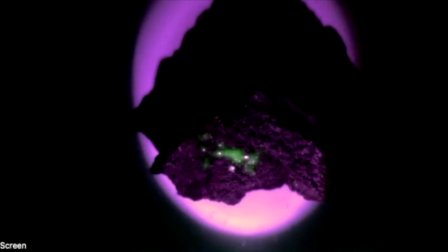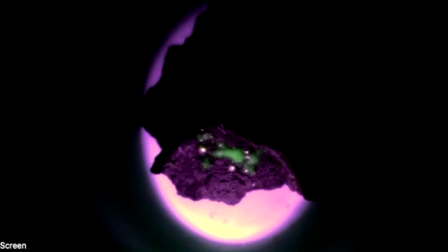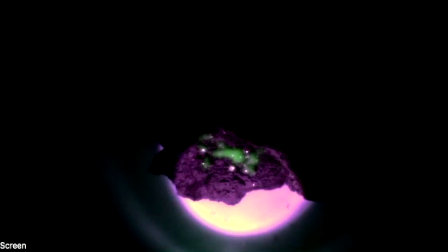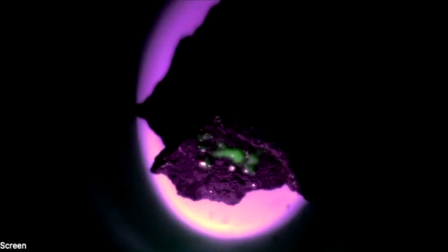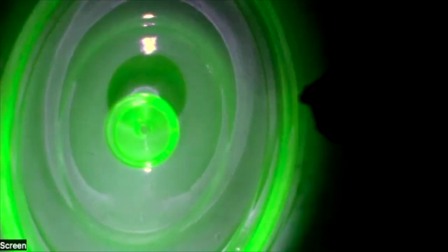Now, we are using relatively weak ultraviolet lights. That way you don't need any personal protective equipment for this, but you can see that green in there. That green is due to traces of uranium. So I can move that off to the side and compare it with some uranium glass, which will glow quite bright because this is a purified version of that. So these are glowing off the same thing.